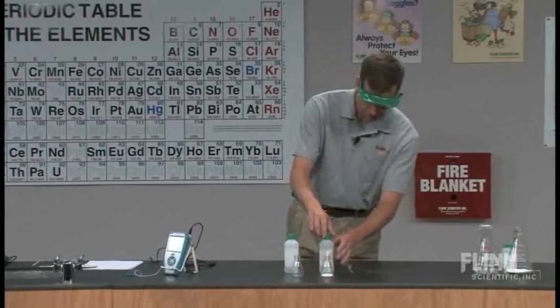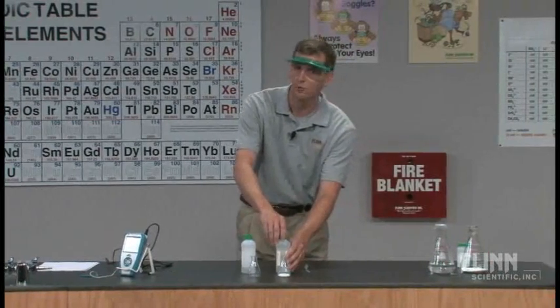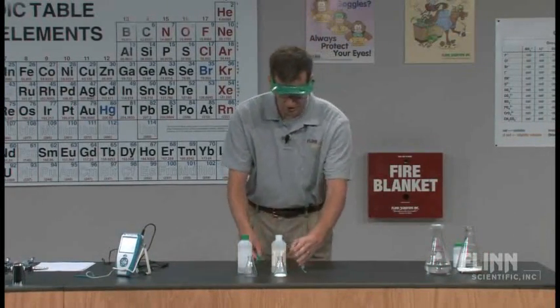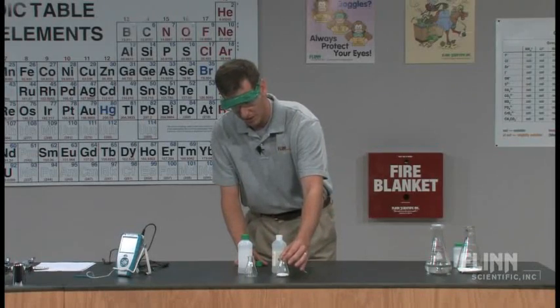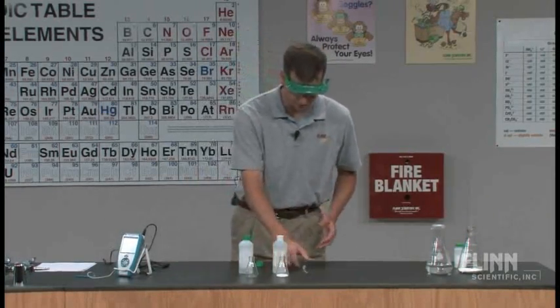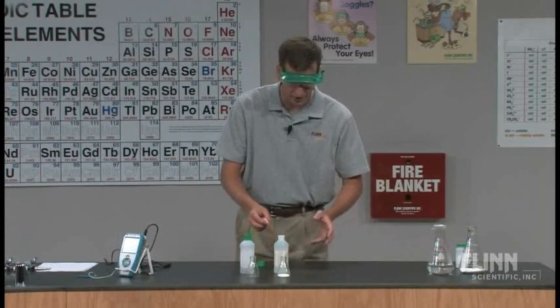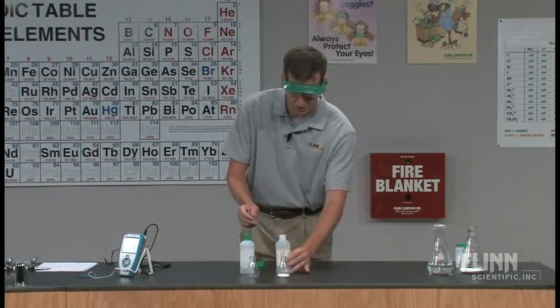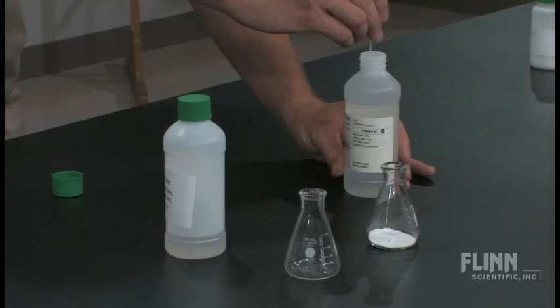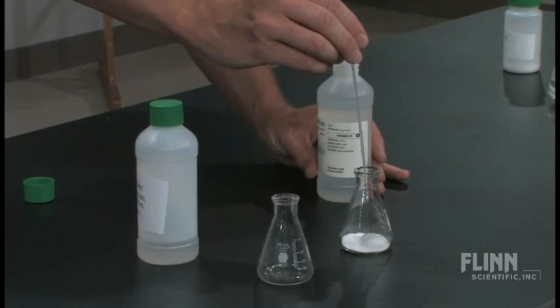The first reaction that we're going to do is one that kids have been doing in elementary, middle, and high schools for years. We're just going to have a little bit of baking soda in the bottom of a flask, and we're going to add vinegar to it — the old volcano for some of the kids out there. It's going to make carbon dioxide gas and froth all over the place. We have the students making observations. I'm just going to take the vinegar and put it in a few squirts onto the baking soda in the flask.